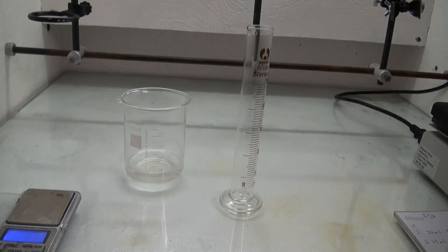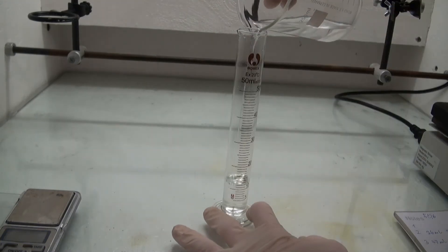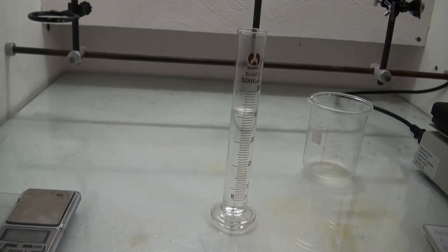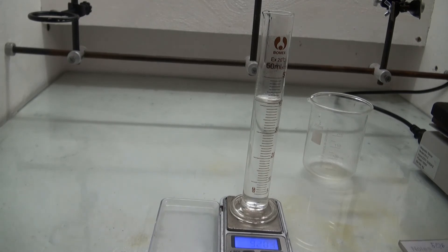The fraction up to 104C was 41 milliliters of water without enough nitric acid to measure it.